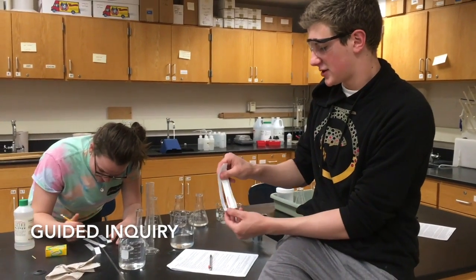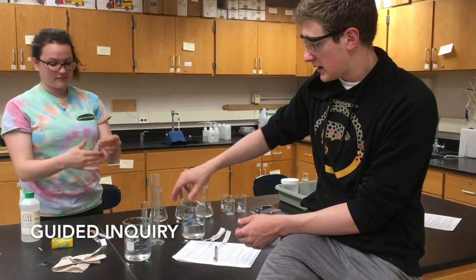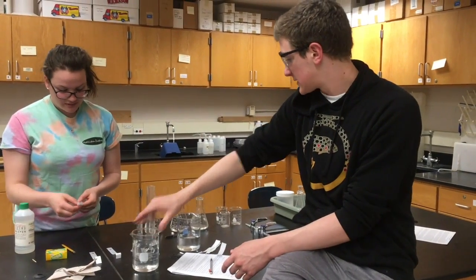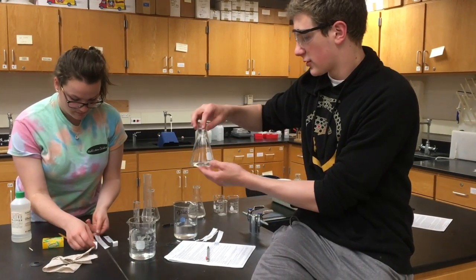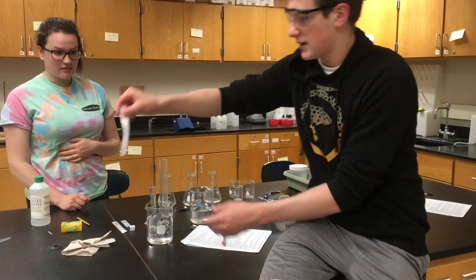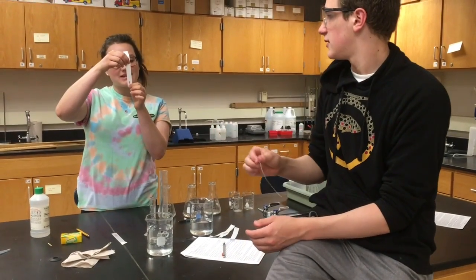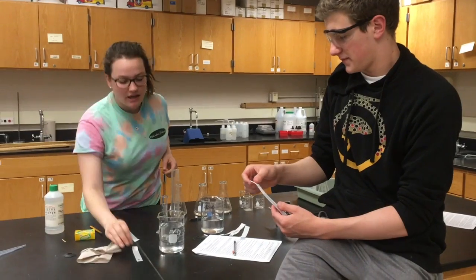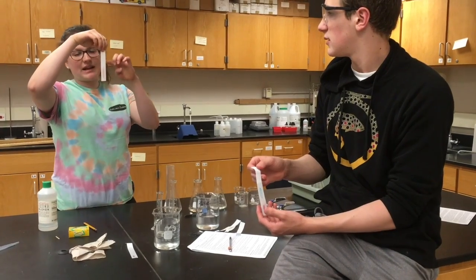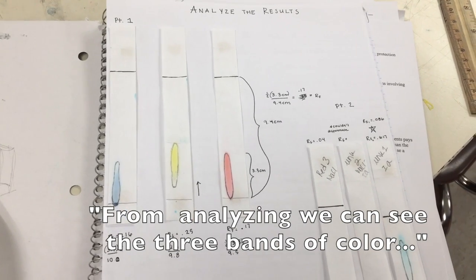We just ran a second trial of the paper chromatography, but instead of just using the 2% NaCl solution, we used 2% isopropyl alcohol, and then we mixed the two, NaCl and the alcohol, to create the third solution, and we ran it, and it created a pretty piece of paper. That's just in the NaCl solution, which is interesting because in the NaCl solution, the colors didn't separate. In just the alcohol, they separated completely, and in the mix, they stayed together, but it's like a gradient of color.